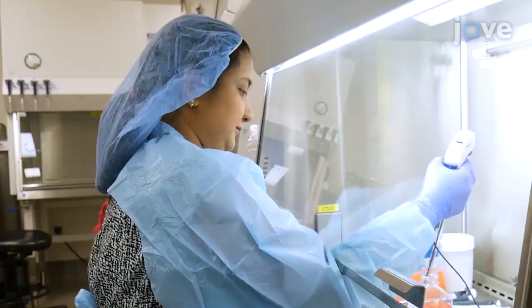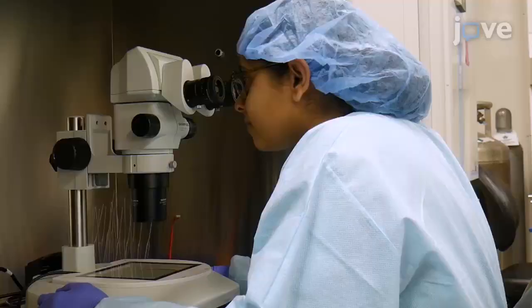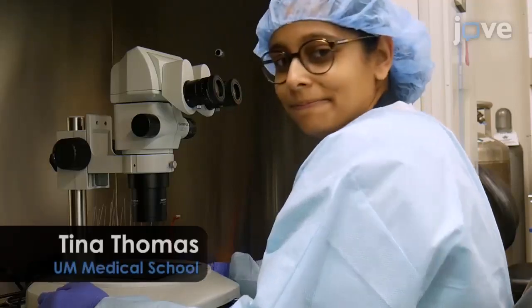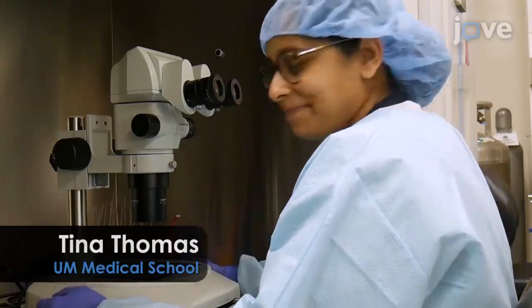Demonstrating the critical steps in the procedure will be Sahidi Chakapelli, a senior technician and our lab manager, along with Tina Thomas, a research fellow in our laboratory.